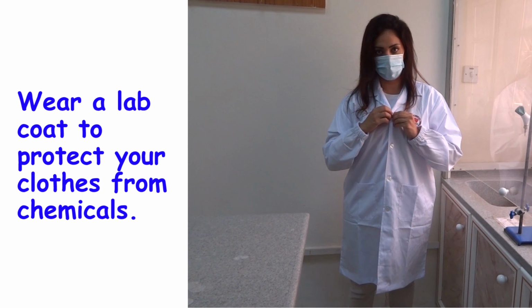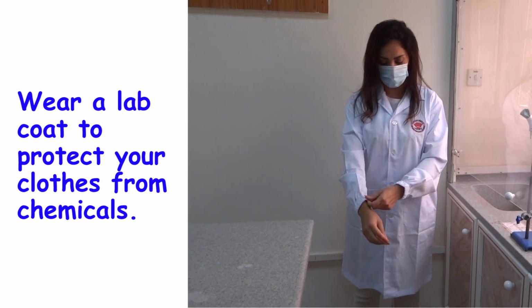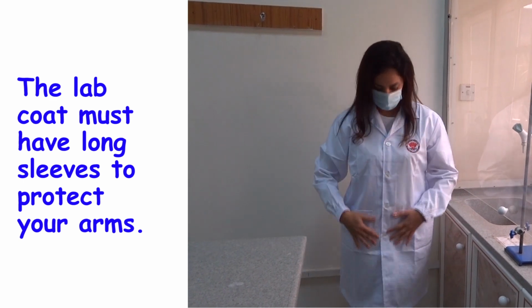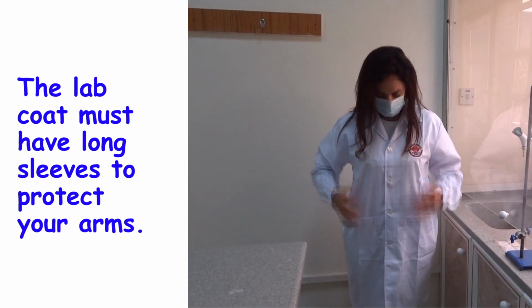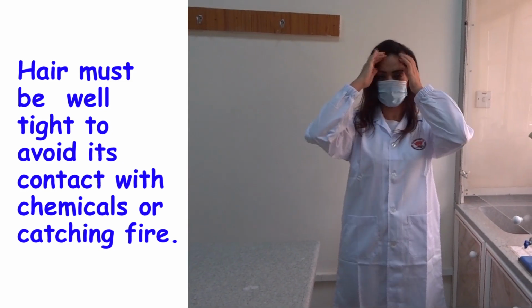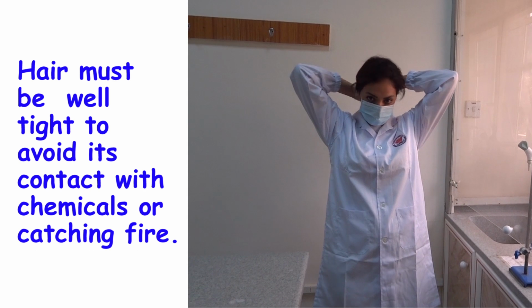First, you must wear a lab coat to protect your clothes from chemicals. The lab coat must have long sleeves to protect your arms. Hair must be tight to avoid its contact with chemicals or catching fire.